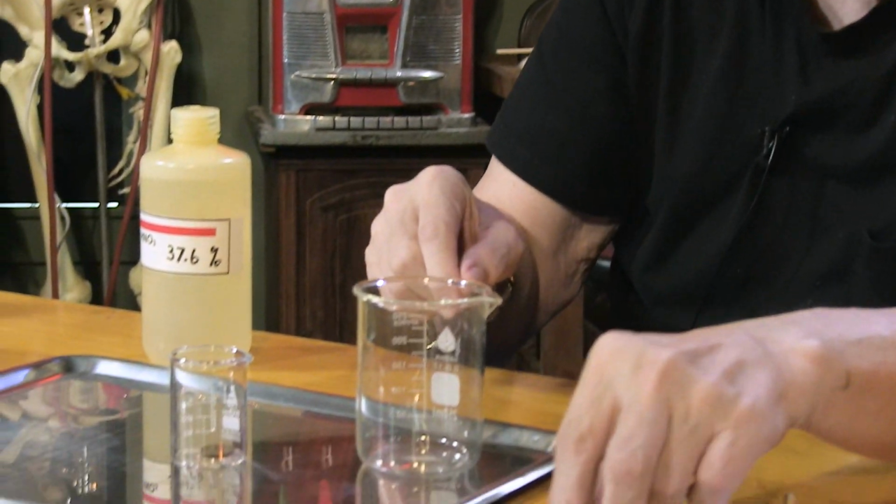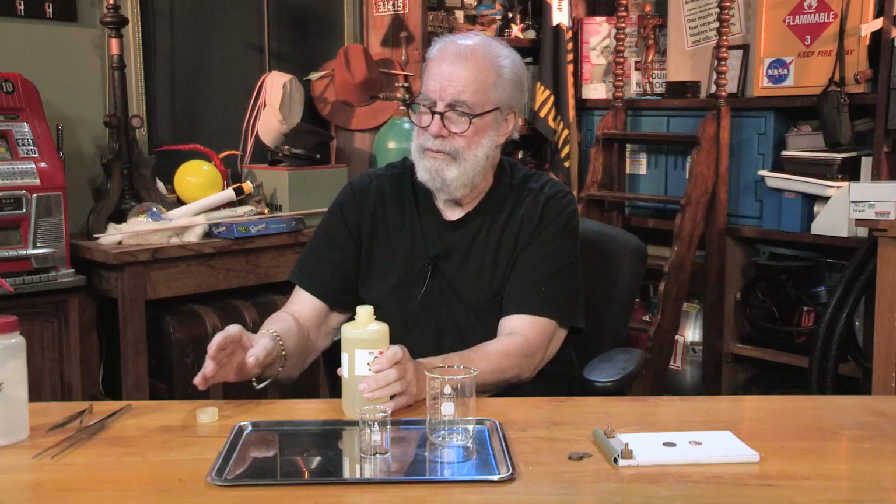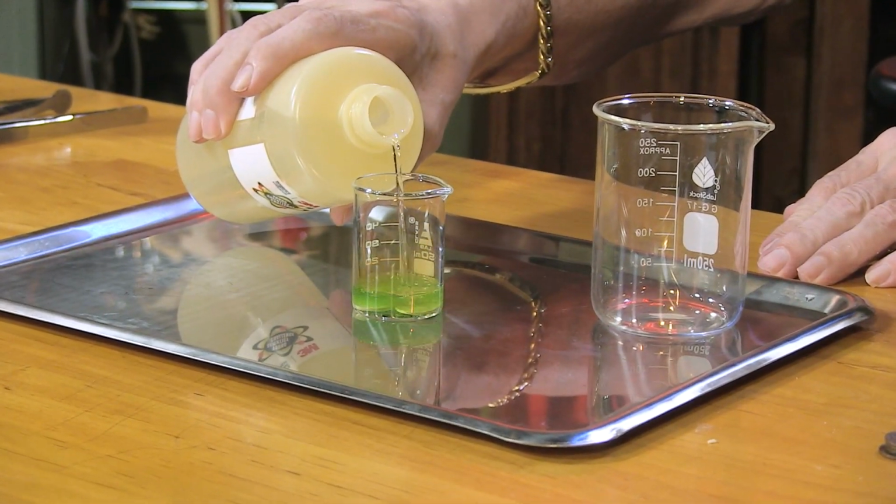And here's a hard old penny. It's been around 45 years. This penny has weathered storms, pockets, rain, all kinds of things. I'm going to put a couple of these pennies in this little beaker right here. And then I'm going to pour some of this HNO3 nitric acid on top. So here we go. And I don't want to get any of this nitric acid on me. If you see me jump up and run, you'll know that I got a few drops on me. Concentrated nitric acid, HNO3.